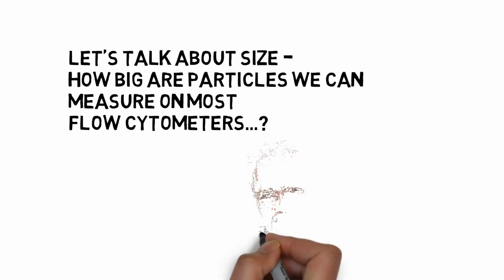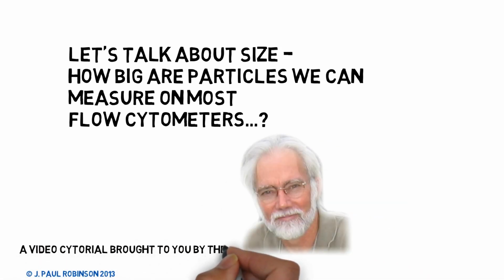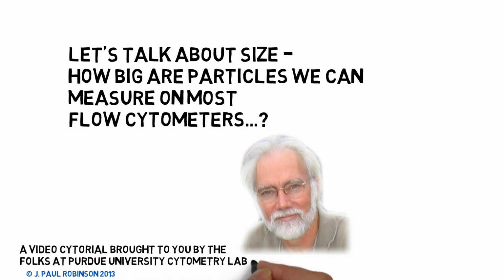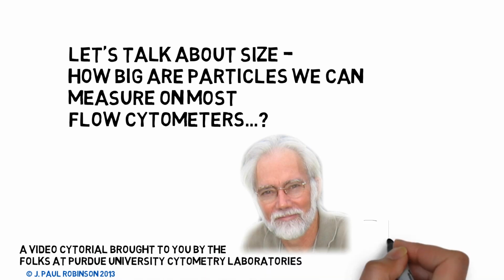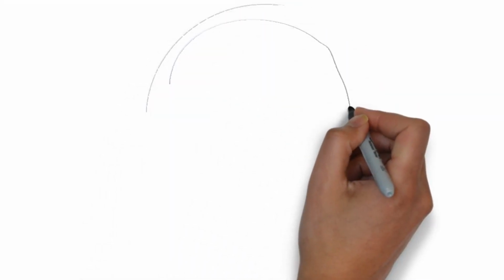The size of particles in flow cytometry determines several things. First, can you see them? Second, the size may be important when it comes to the volume and surface area we're talking about. This quick demonstration will give you a perspective on what a flow cytometer can do with different size particles.